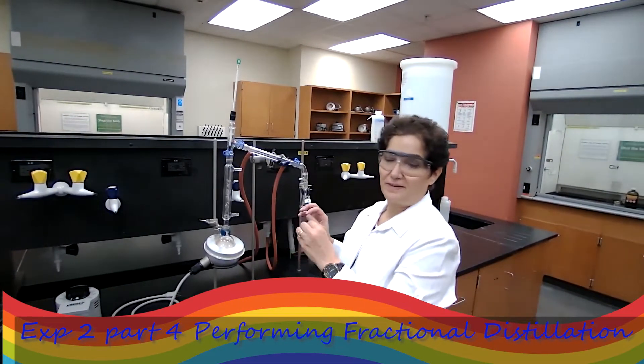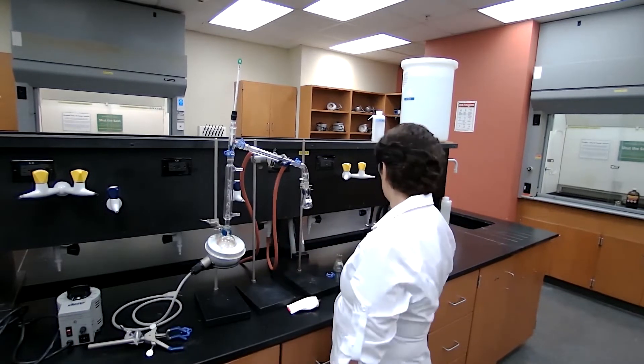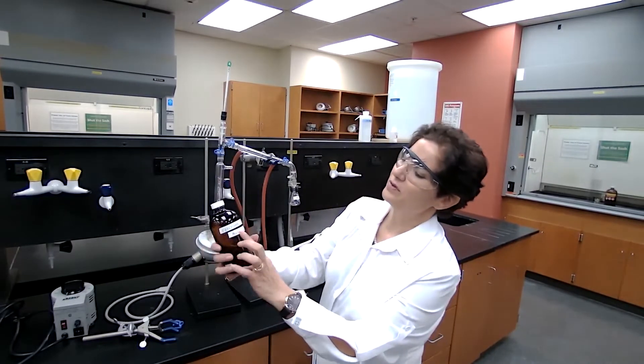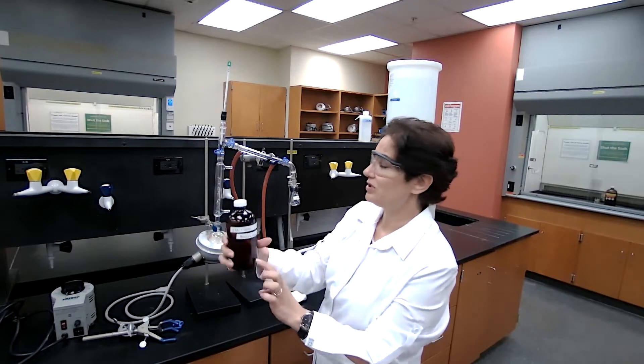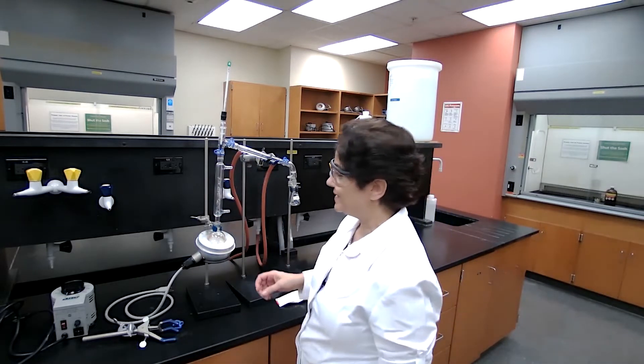Okay, we are starting our experiment for fractional distillation. For the fractional distillation, an unknown will be given to students and we are going to use the unknown. It says fractional distillation mixture and to fill the flask.